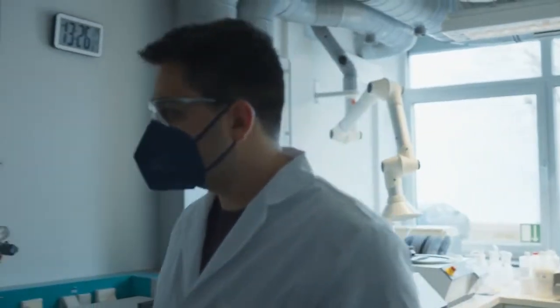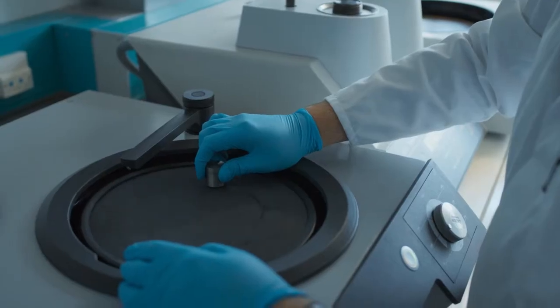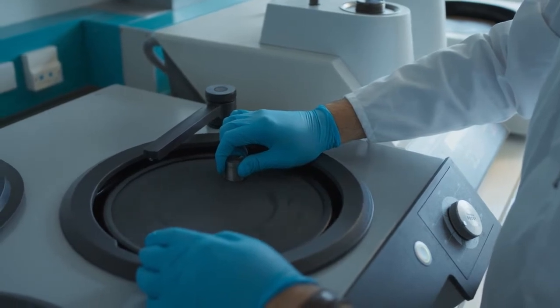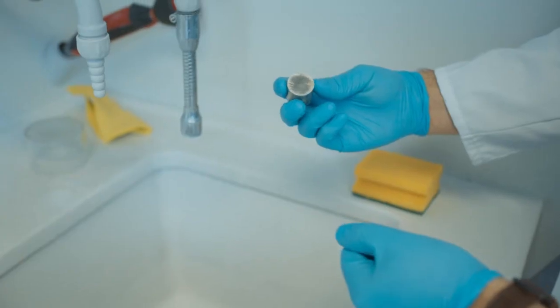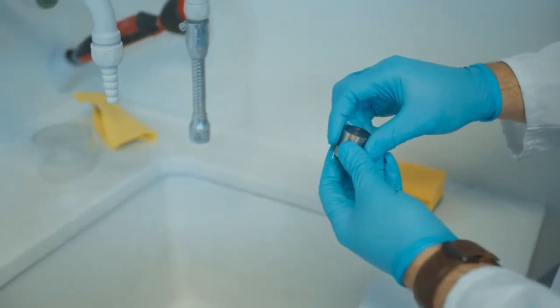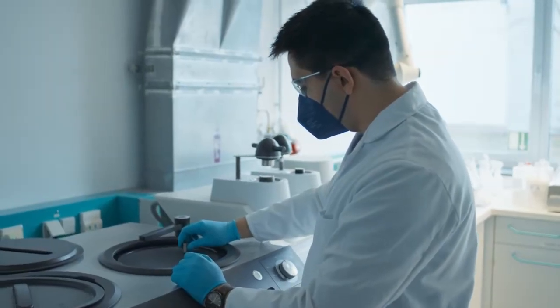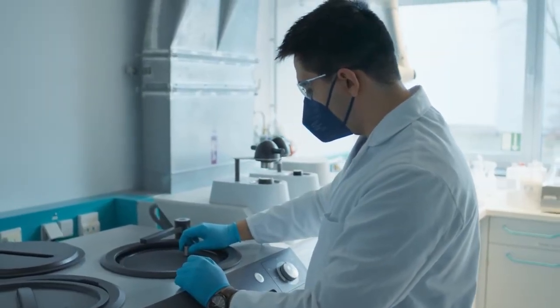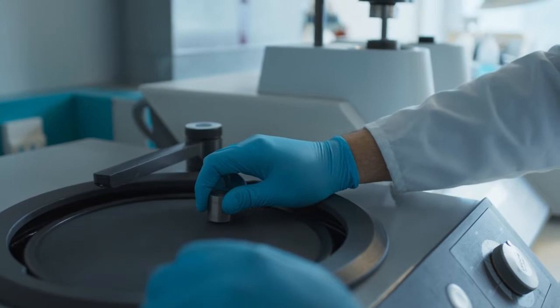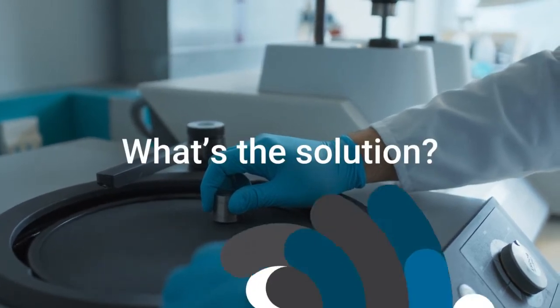Another problem is that we need to prepare our samples. If you put a part of random material under the microscope, we cannot expect to get high quality data from it. That's why we scientists spend a lot of time in the lab to prepare our samples to the desired parameters needed for the microscopes.